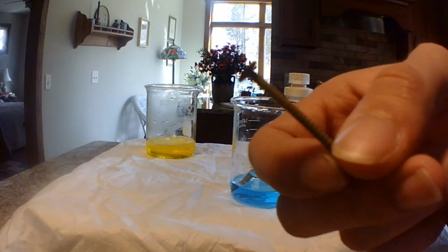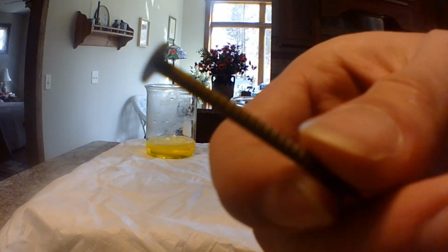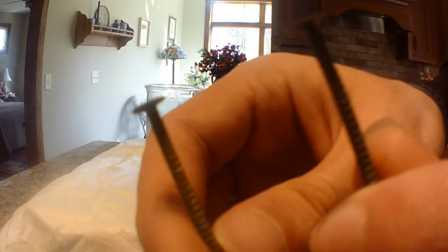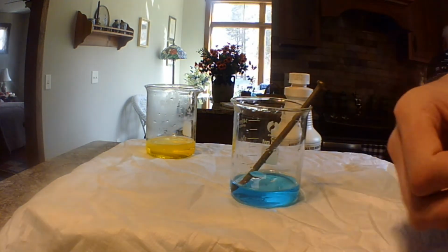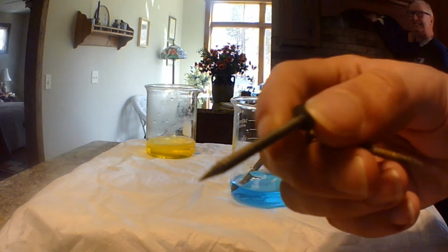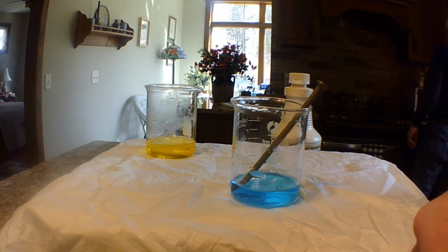Here's one that was left in for a few minutes inside this solution. As you can see, this is what it's supposed to look like, and this is the difference. It started to rust again, but this is an unrusted regular nail. There is a lot of differences. This one feels a lot smoother than this one. This one's a lot more rough, because the outsides of this dissolved in the hydrochloric acid. And here's a regular rusty nail. Lots of 3 different nail things.